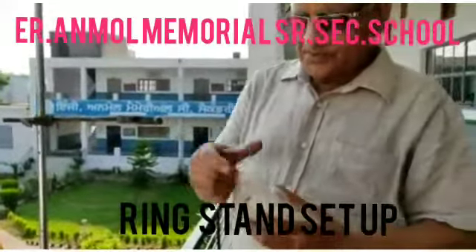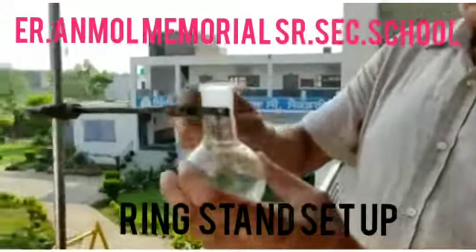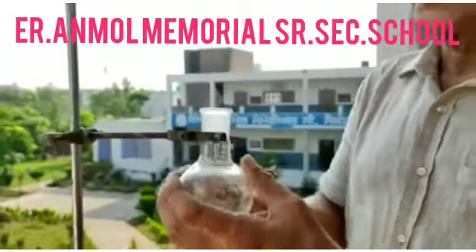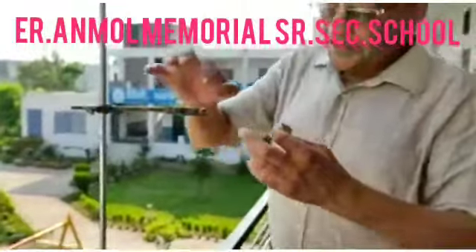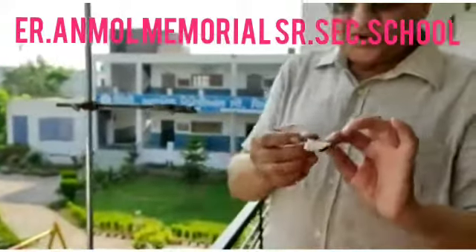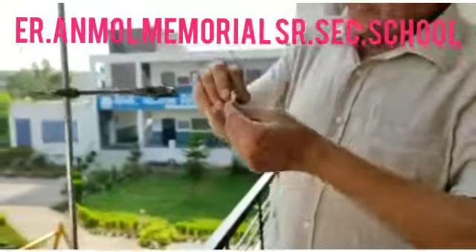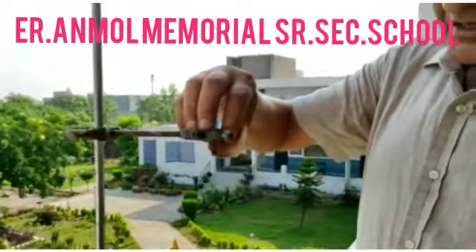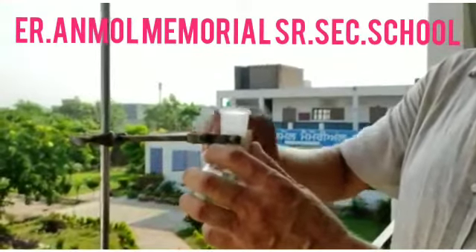One important thing I am going to tell you — while keeping things here, you can turn it clockwise as much as you can easily, so that the round bottom or flat bottom flask is not broken. For safety purposes, sometimes there is a rubber attached here, but here the rubber is not attached. So you can take a paper, roll it many times, and keep the paper here. This paper is a safety device to avoid things from being broken.